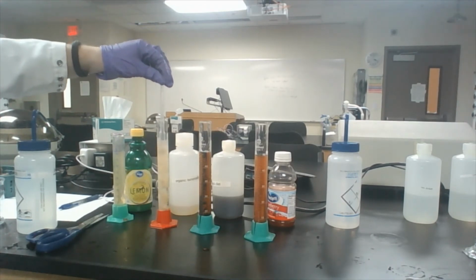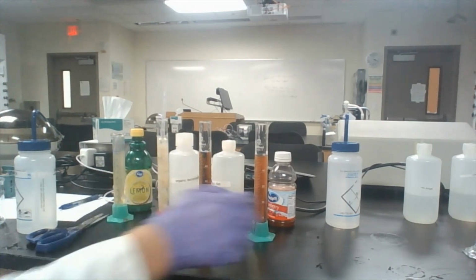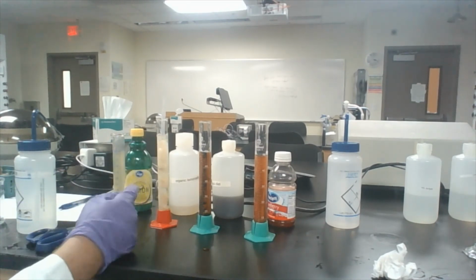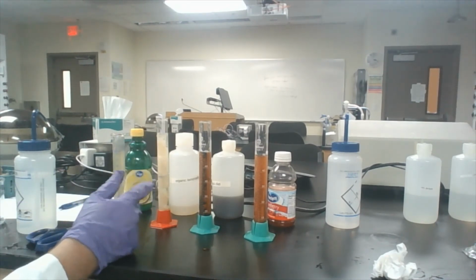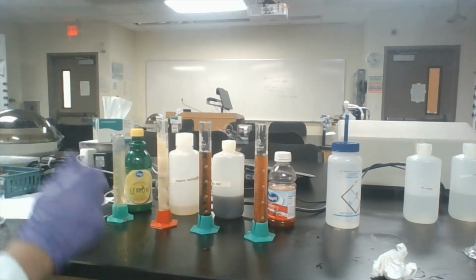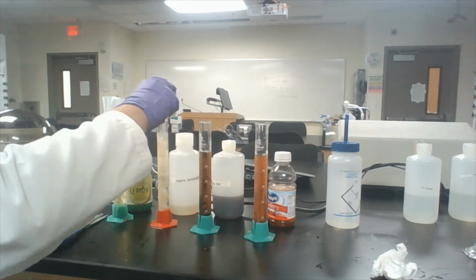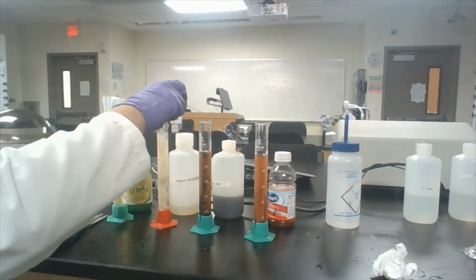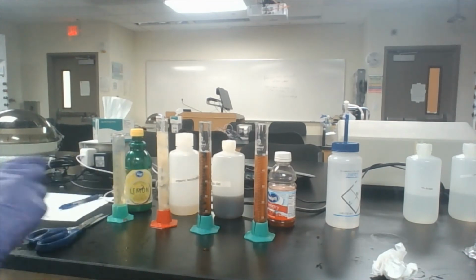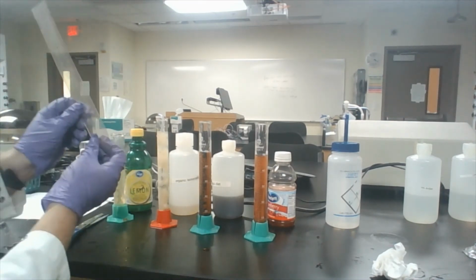So this is our lemonade. Holy cow. Now there's some viscosity in here because this actually has pulp. So we're going to let it sink here just a little bit more than usual, just to make sure that the pulp is not holding it up. So you might want to use a pulp-free one, I guess.